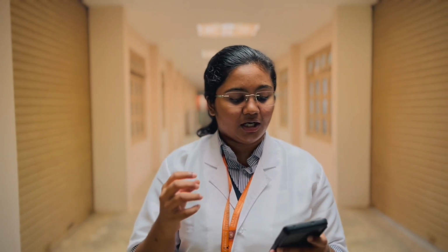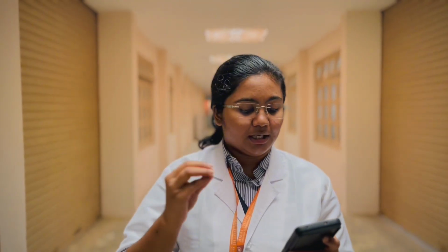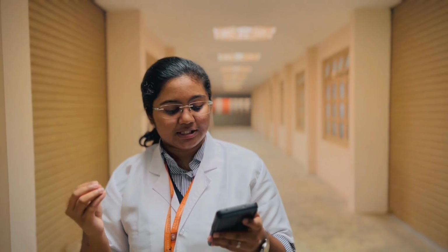And then let's see the preparation and handling of chemicals. We have to use dilute solutions only to minimize the risk, and always label all the containers. Don't mix up any reactants. It can lead to a violent explosion and risk our lives. Also never taste or directly smell any of the reactants in the lab. During the experiment, assemble the coffee cup calorimeter securely and pour the chemicals with all the safety measures. Also make sure all your teammates are following the safety measures.